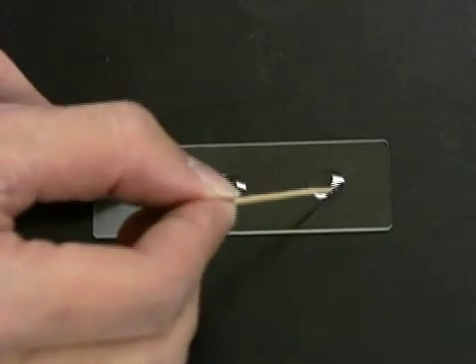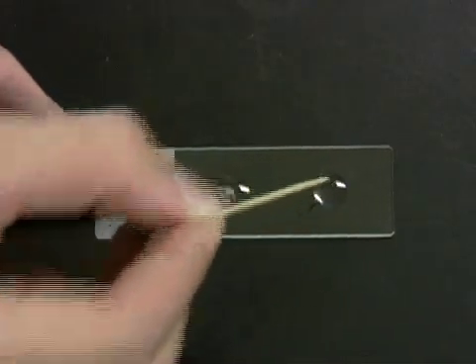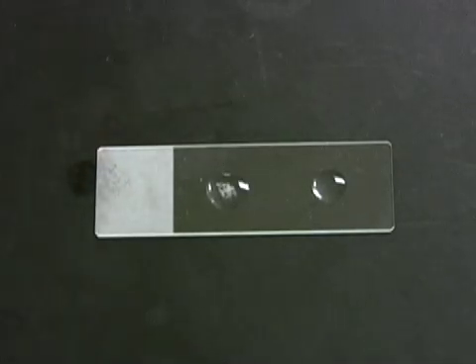Next comes the Streptococcus mitis. You will notice again that no bubbles form, indicating that this organism is catalase negative.